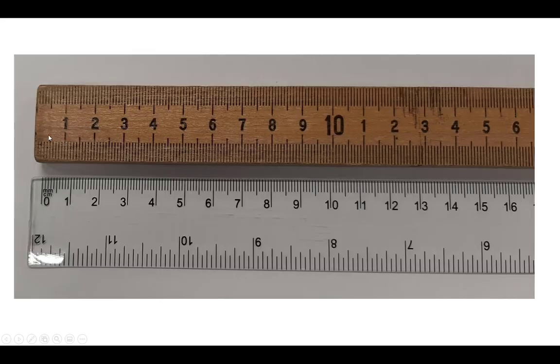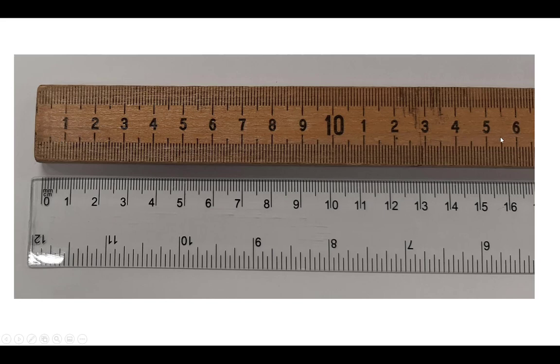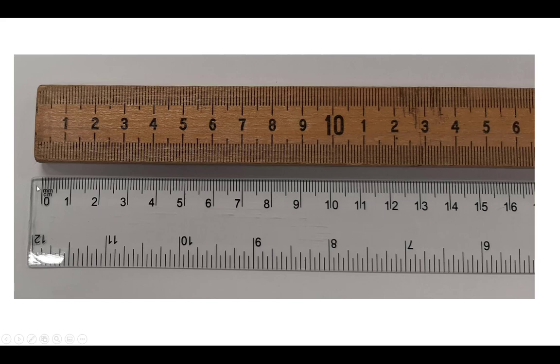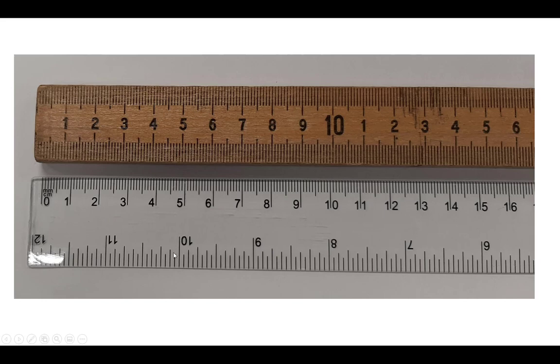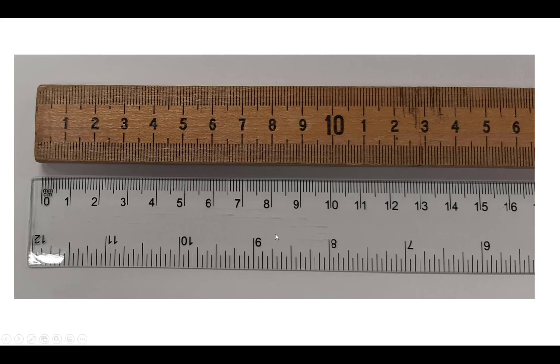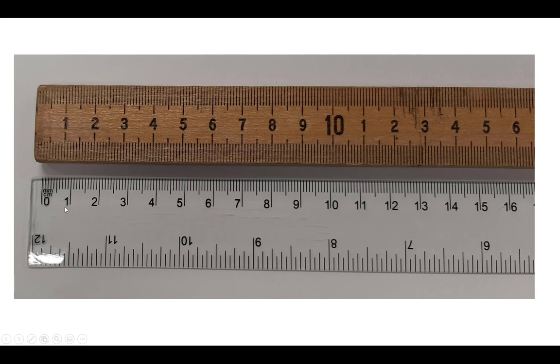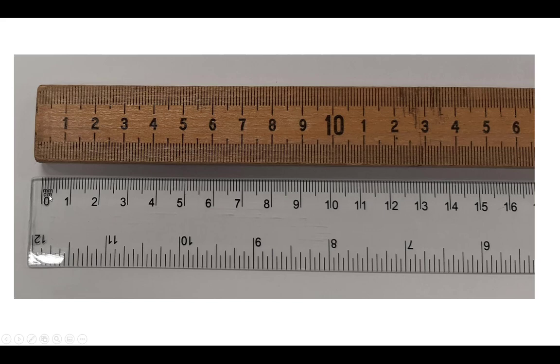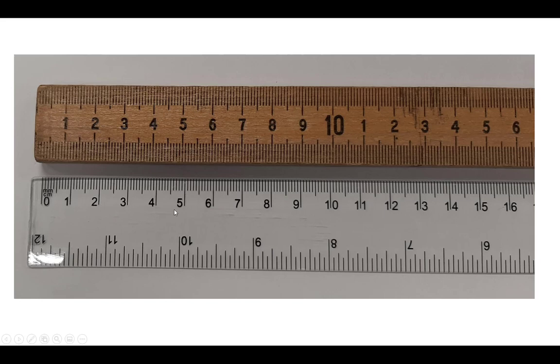Up top here we have a picture of the left side of a meter stick — this continues all the way to 100. And here I have a foot-long ruler with the inches side turned upside down; if I kept looking, this would go to 30. I have these set right next to each other so we can see that each of these markings stands for a centimeter. It might be a little confusing because we have MM and CM there, but the CM definitely corresponds to the numbered intervals.